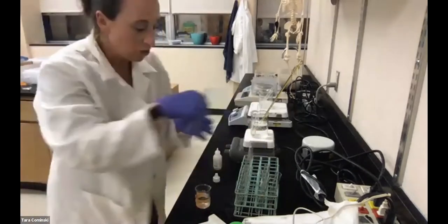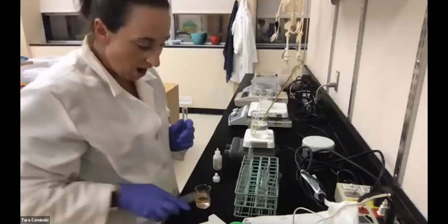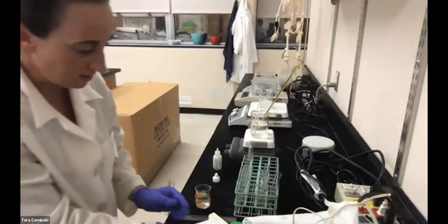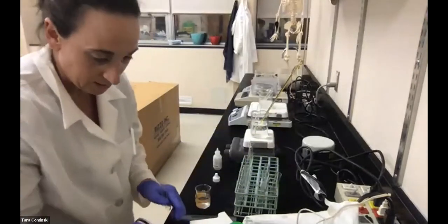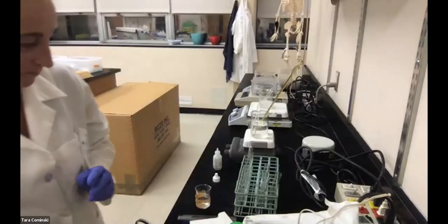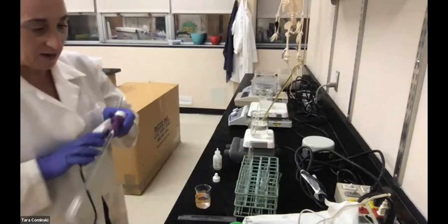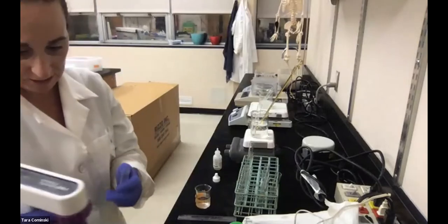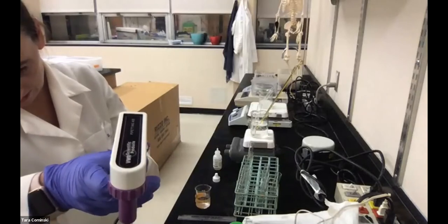Now tube 2 is going to be water and hydrogen peroxide, okay? So I'm going to need to switch this. This is a mess here. We're going to get some water. You can think about what's missing from these tubes. So we got water in this one.